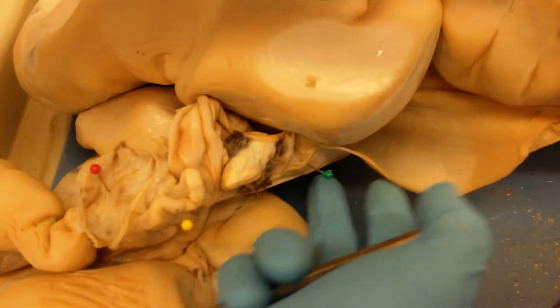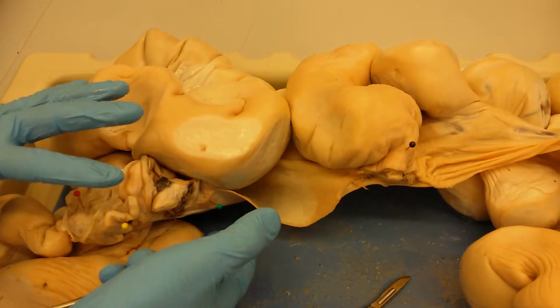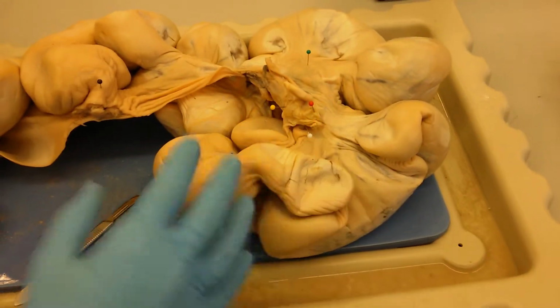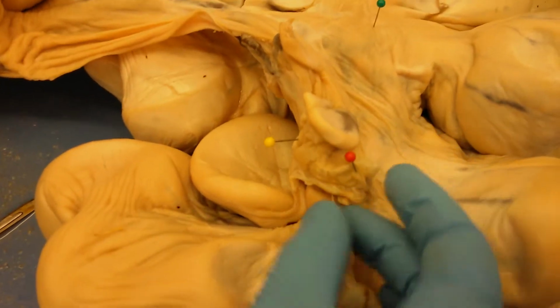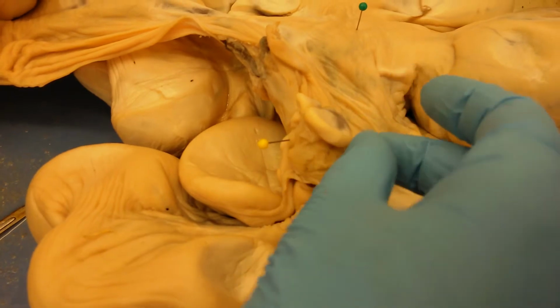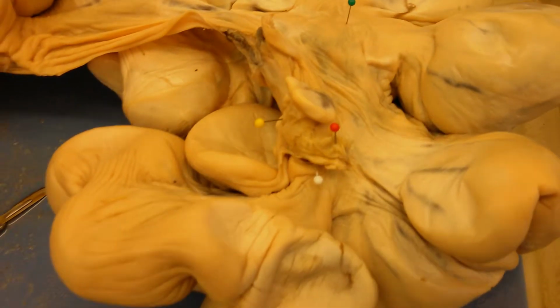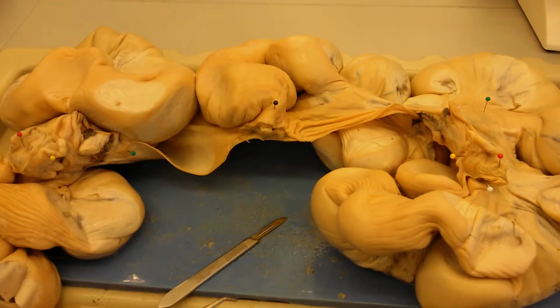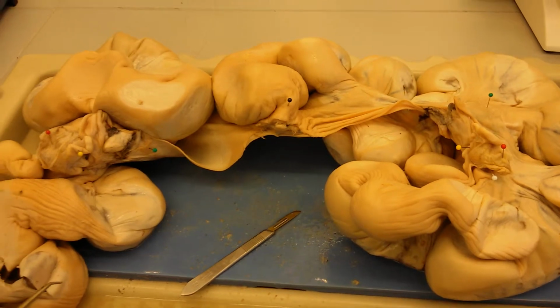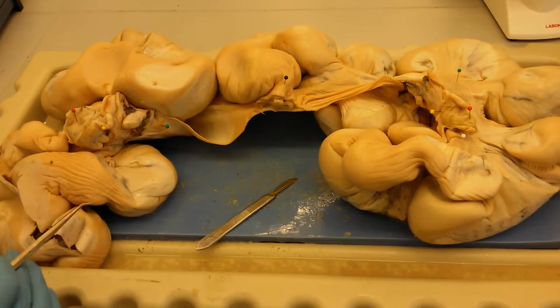And then there are two uterine horns. This whole structure here is one uterine horn, and this structure here is the other uterine horn. And obviously here you have a second ovary right here, and you have this second infundibulum, and you have another uterine tube. And then this is the body of the uterus. So again, this is a Y-shaped structure in the pig. This will be a monopartite, more pear-shaped structure in humans.